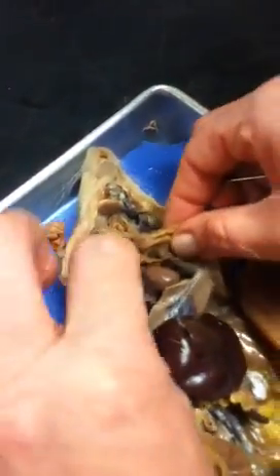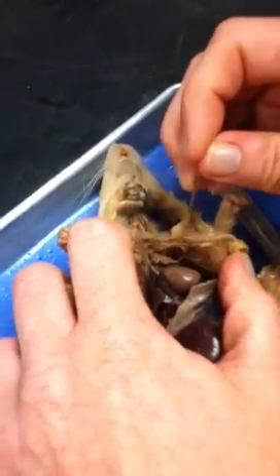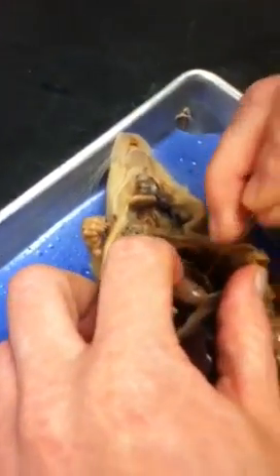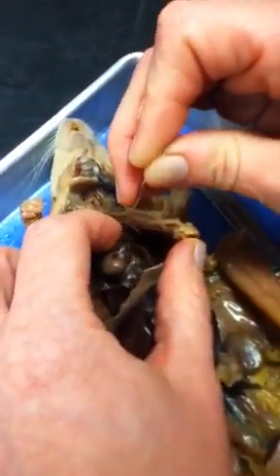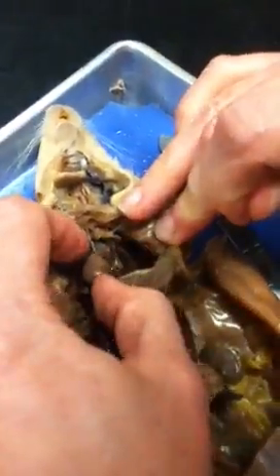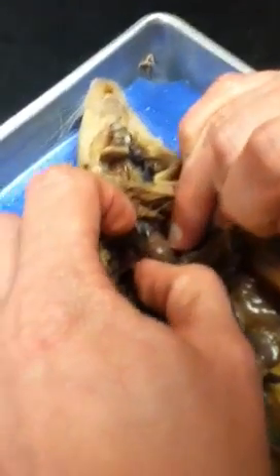Opening up your thoracic cavity. The heart. You have your heart, but you have to be very, very specific. Okay. Ventricle. You have your two ventricles. It is separated by your septum. So you have to find your septum first. Septum is going to be a line. There it is right there. There's your septum. I see it.